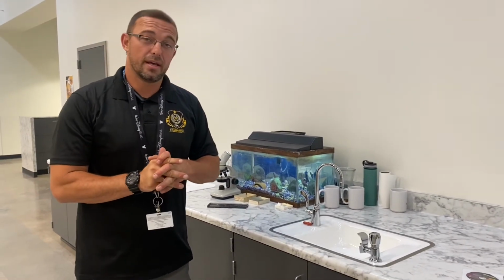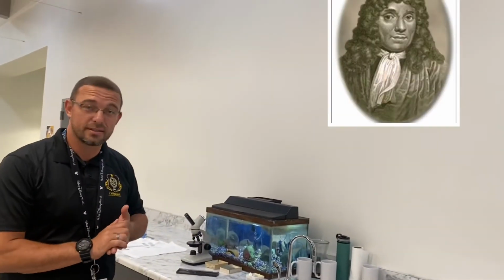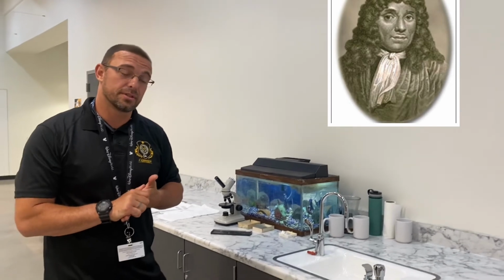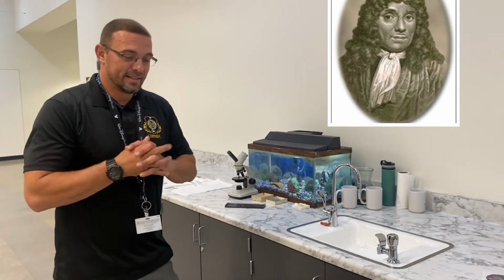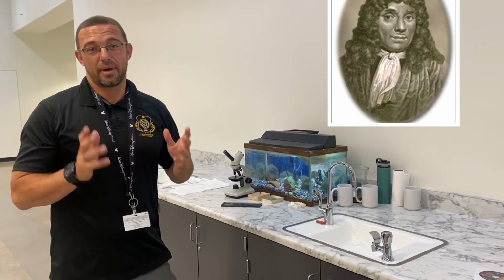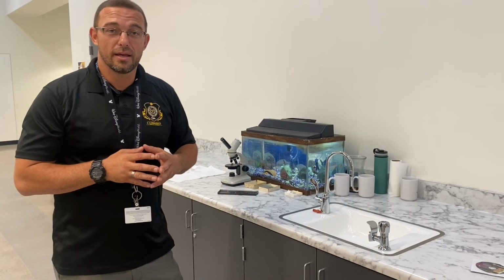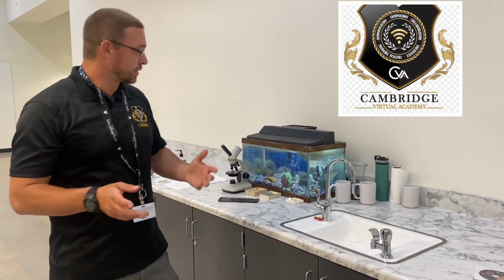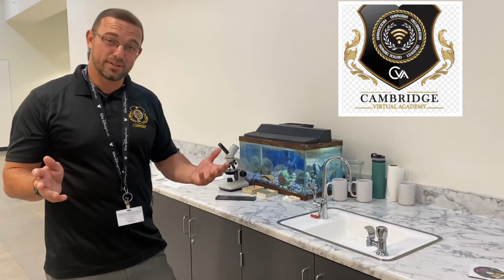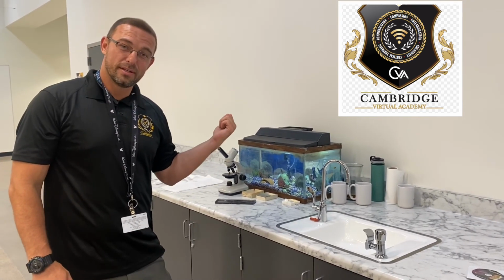Have fun and take a look back at how Leeuwenhoek, the Dutch scientist from the late 1600s, number one, increased the scientific importance of the microscope, going beyond the compound microscope, which is what we're using today, and also taking a look at this idea of pond water and what's in our water. So we're going to ask you to do the same thing that Leeuwenhoek did in the 1600s and see what's up with water in the CVA fish tank.